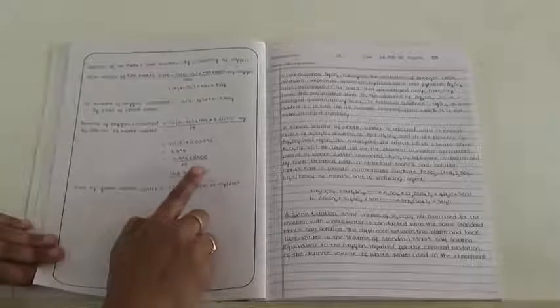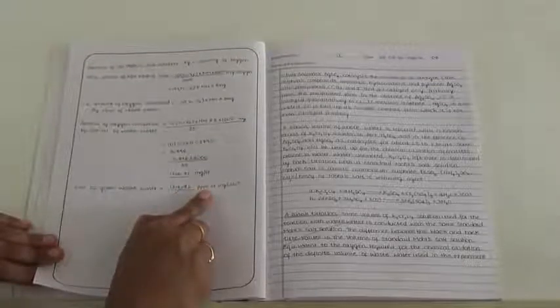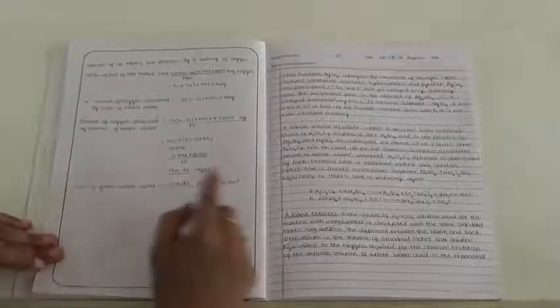The same value can be expressed even in terms of ppm, and here the final unit is parts of oxygen per million parts of wastewater, or milligrams of oxygen per decimeter cube of wastewater. The final answer is written in this result value.